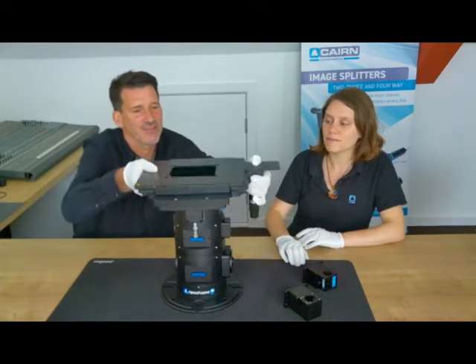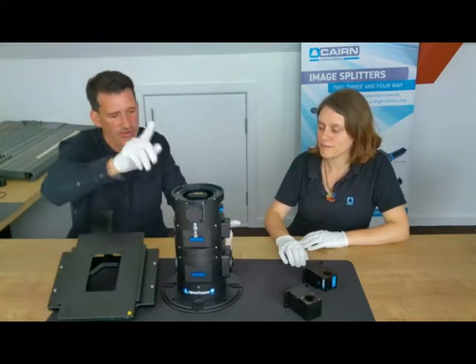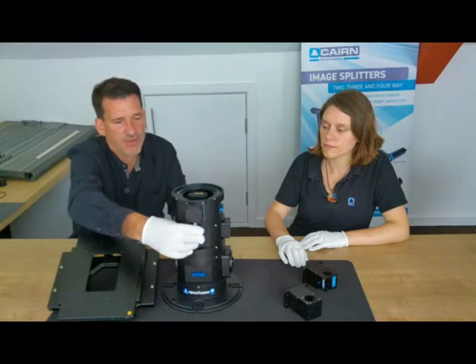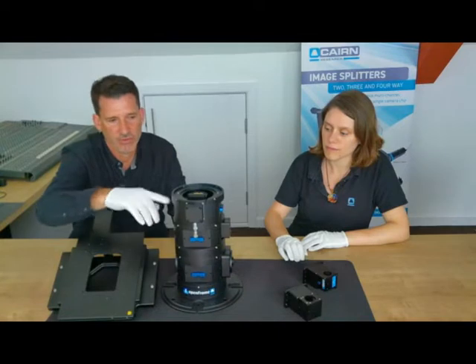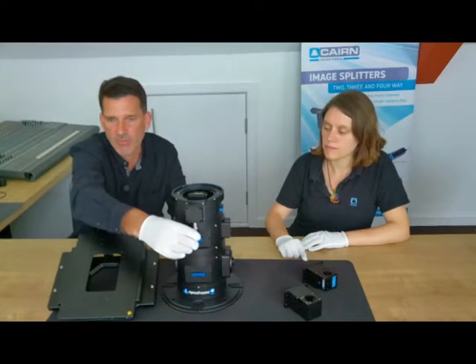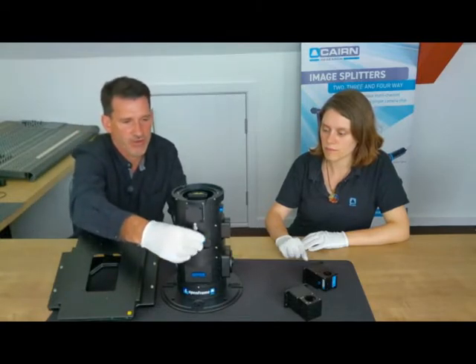Moving down the openFrame, we get to the guts of the instrument. So this is the whole point of the openFrame: it's centered around the objective and around a single optical train in infinity pathway. So this focus layer houses the objective. We base it on a single long travel axis. In most cases, this will be a motorised linear stage that we've developed specifically for the purpose, like a fully encoded high-speed stage. In this instance, we've got a differential micrometer, so this is for a sort of low-cost version.